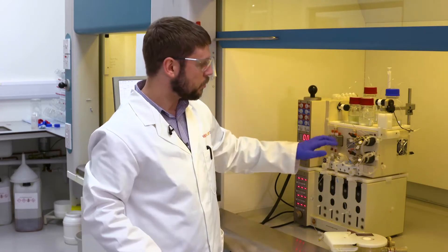My two reagents are ready to go. I just need to load the pumps, fill the backwash and put the reactor on. So let's do that.